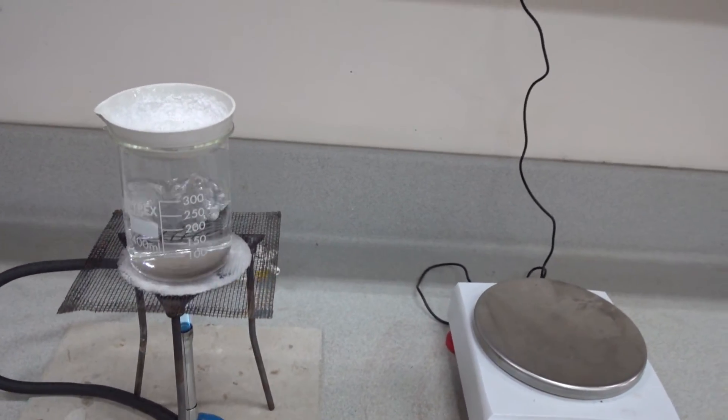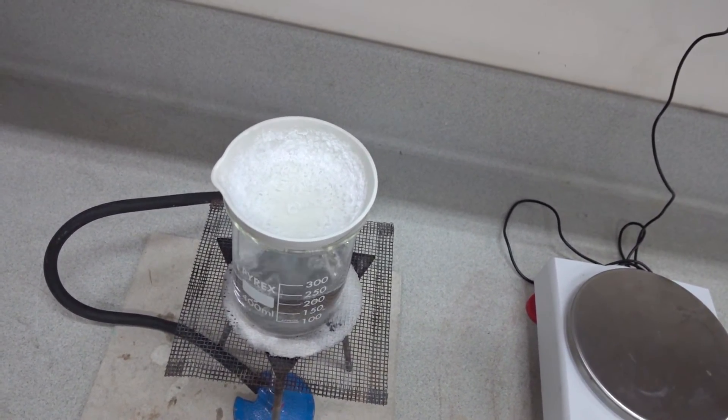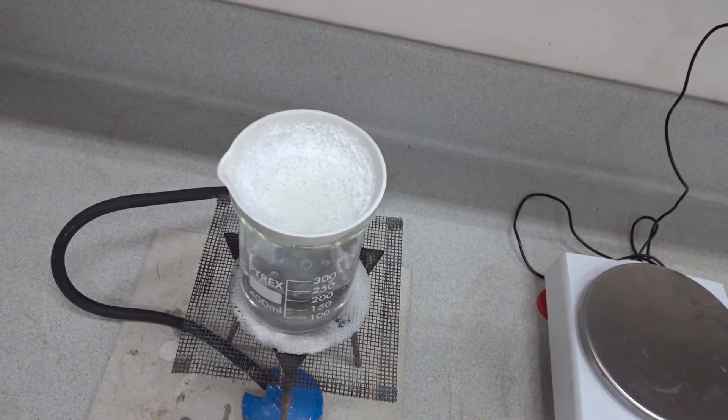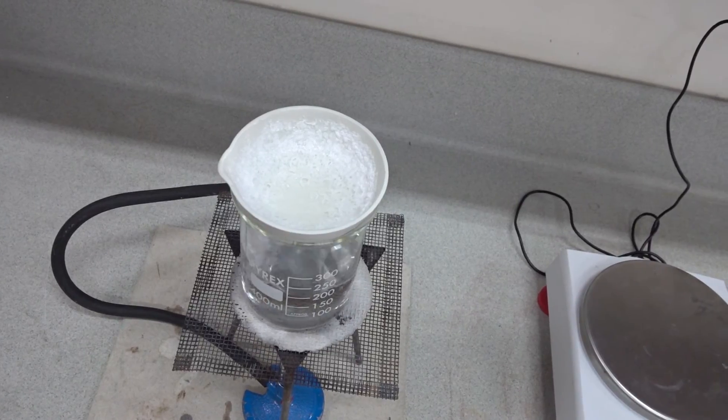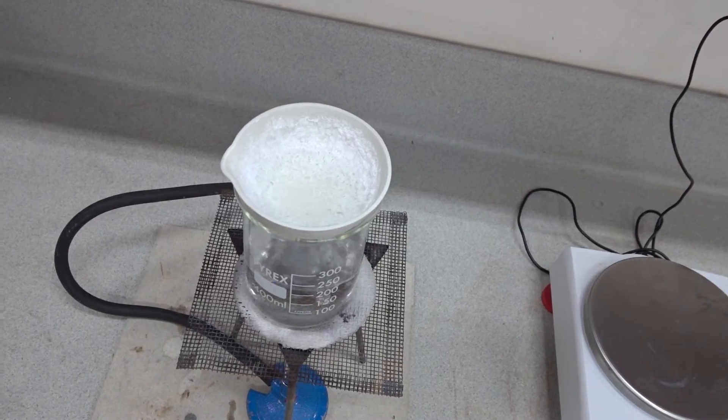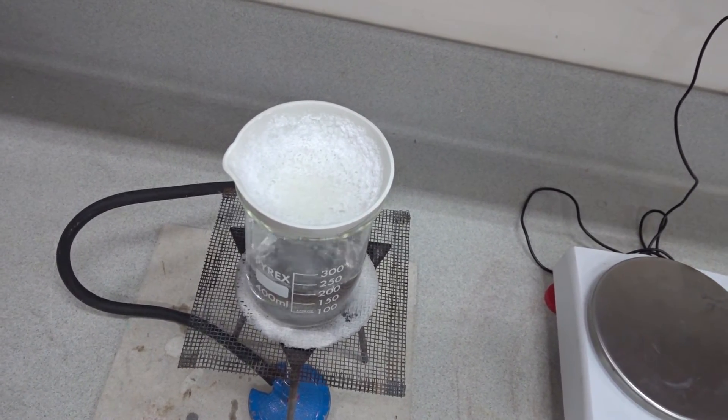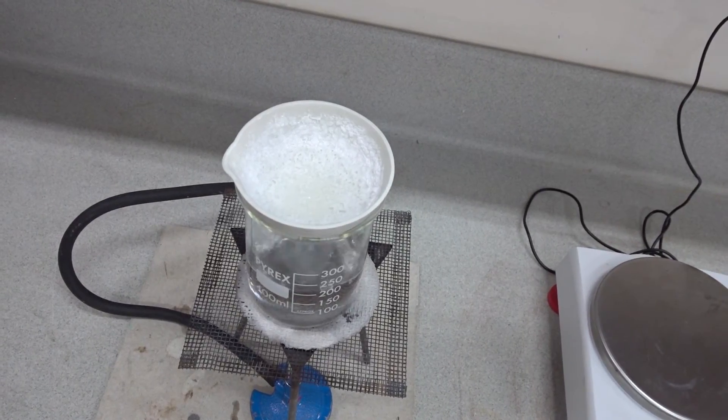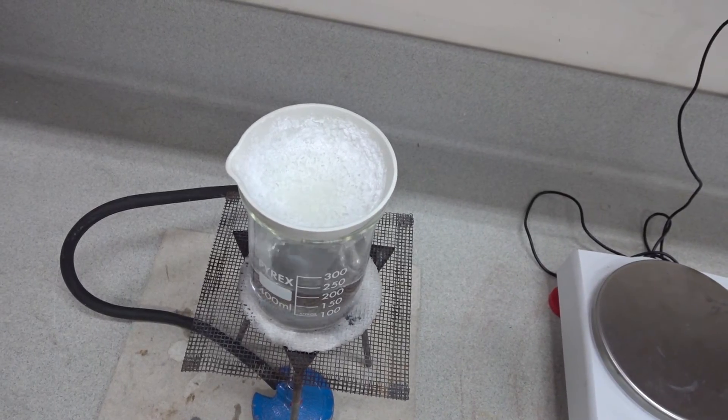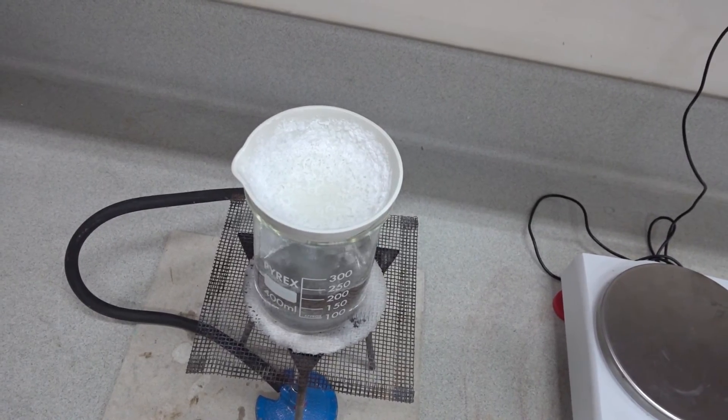If we change the angle of the camera we should be able to observe bubbling as the last remnants of water are evaporated. Bubbles form on the surface skin of the crystals and we hope that we don't lose any material from the evaporating basin as those bubbles burst.